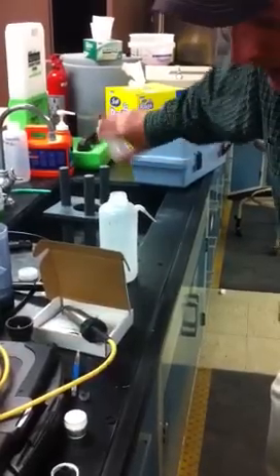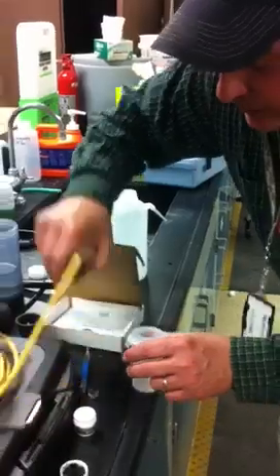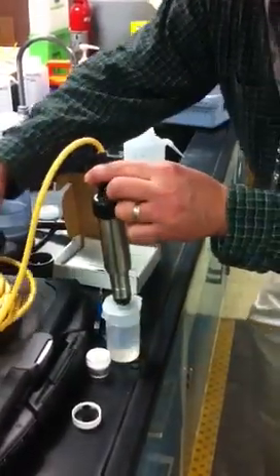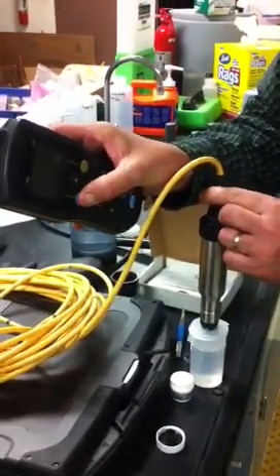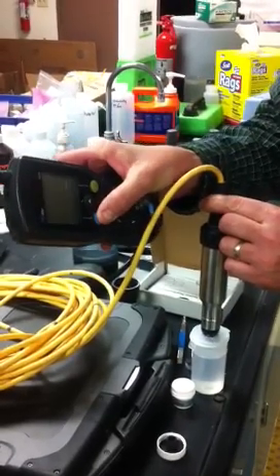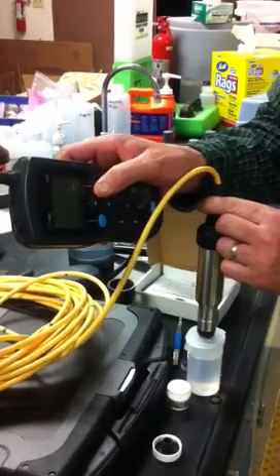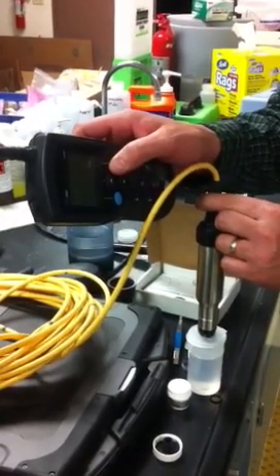We're going to speed this up. Skip past to 1 minute, and then this probe goes in the hole and should not touch the water. Then you hit the calibrate button, and it has a timeline on how much battery you have left. This one says 0 days. You hit read, and it will stabilize just like recording a data point.